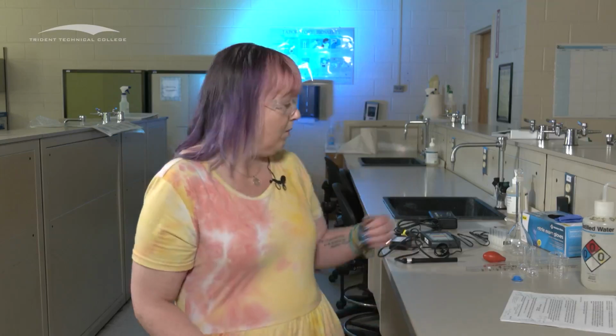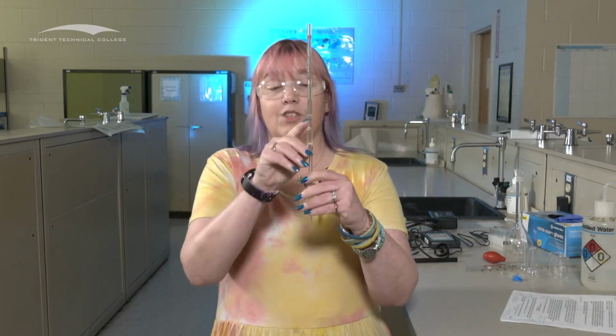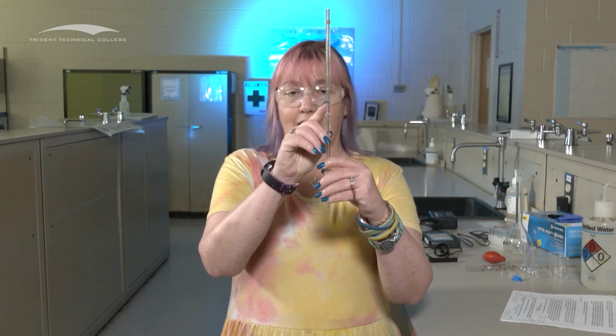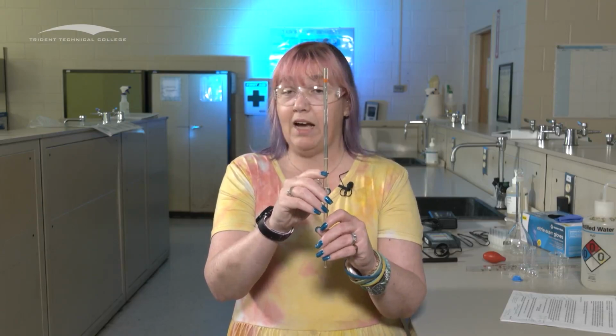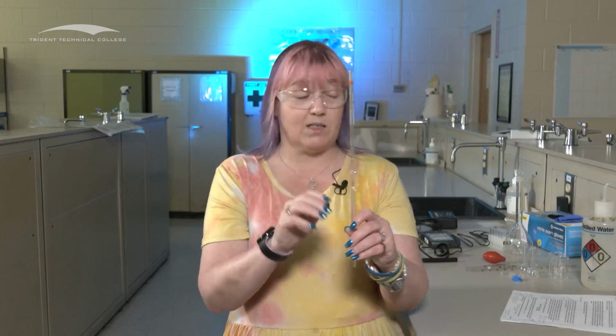So on a graduated cylinder, we can estimate beyond the last measurement that's there, in between those last measurements that are there, and so we can estimate that last data point. When we talk about something like a volumetric pipette, there's a finite measurement that's here, and we can't estimate beyond that. We know exactly what that is, and so if this is a 1 milliliter pipette, we know that this is 1.00 milliliters. That's the precision that we know for that particular instrument.